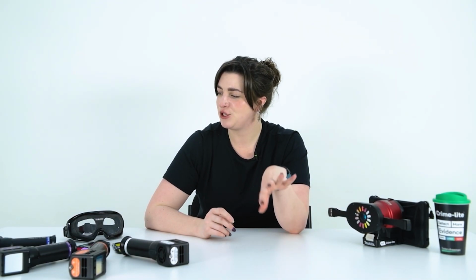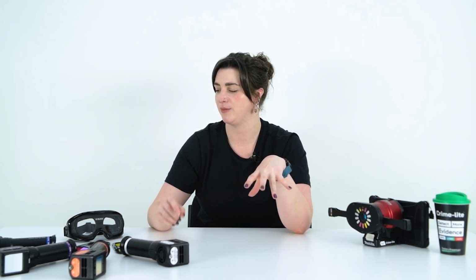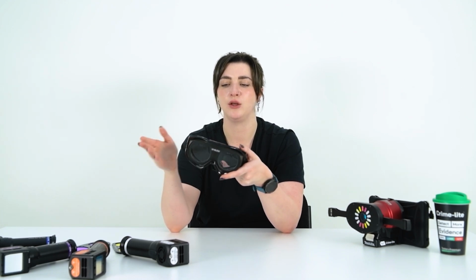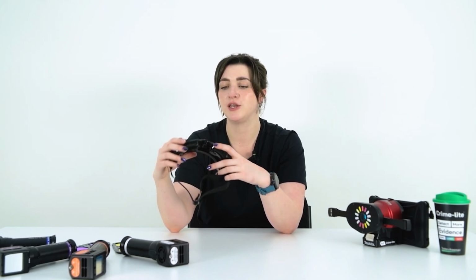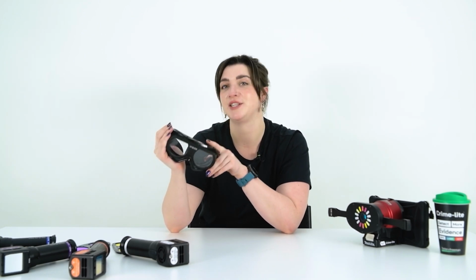The Crime Light 82 Pros come alongside the Crime Light Pro Vision goggles. These are a bit different to the style of goggles that we used to sell here at Foster and Freeman because they start off with a UV blocking base. The base of the goggle is UV safe and will block out any UV light from entering the eye.